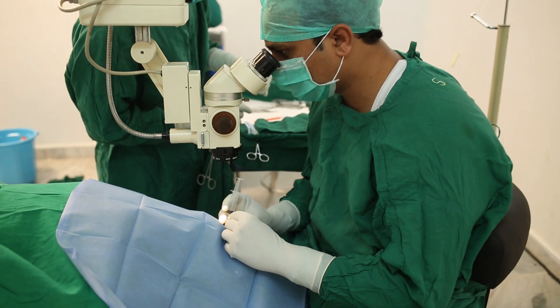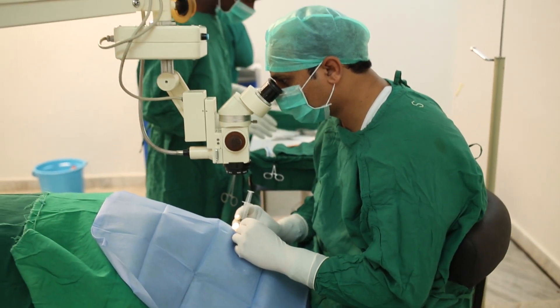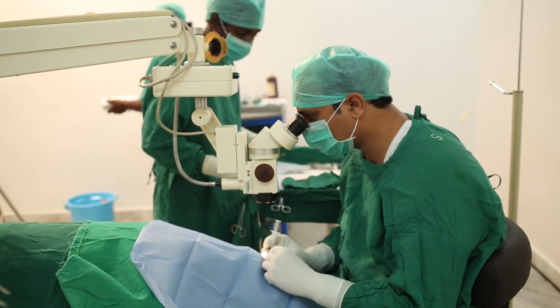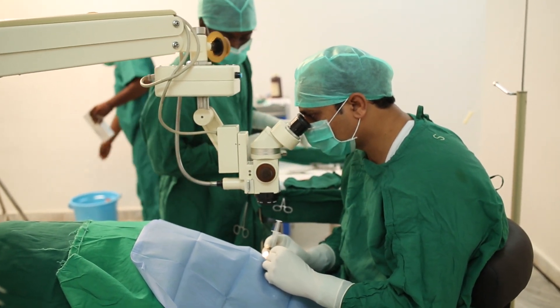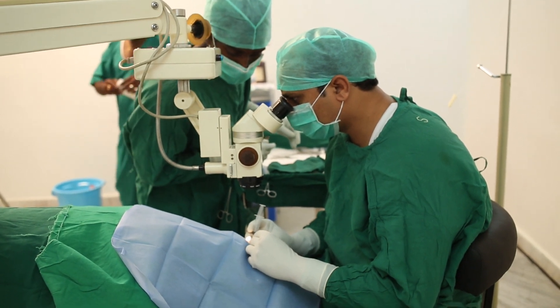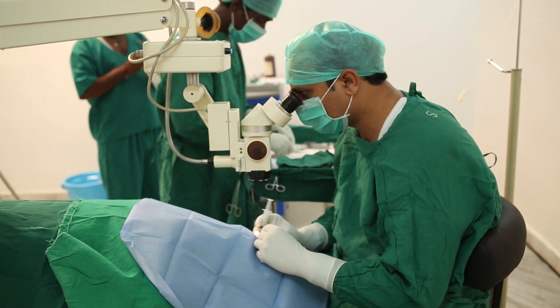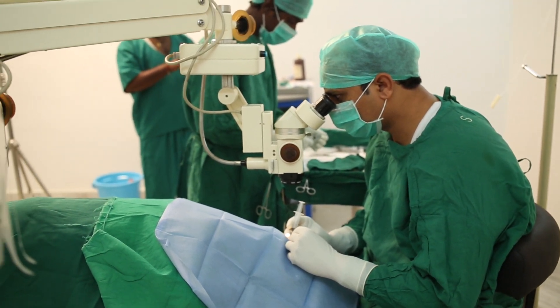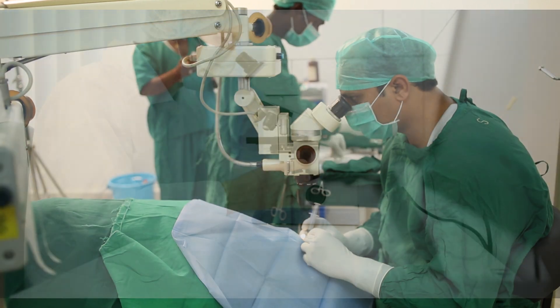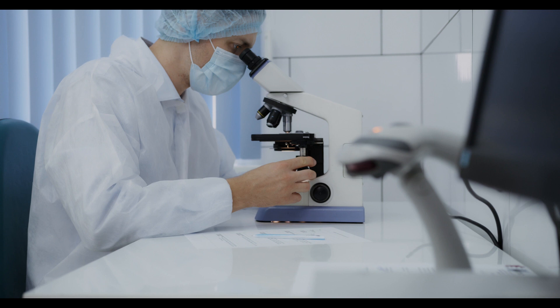For example, if you take a tumour out of an individual, you will proceed to do an incision around the area the tumour was thought to be in, take a section of that, and see whether or not there continue to be tumourous cells on the periphery of the section. If it's still present, the surgeon will continue to cut away and further expand the incision. It can also be used for certain Cryptococcus fungi species.